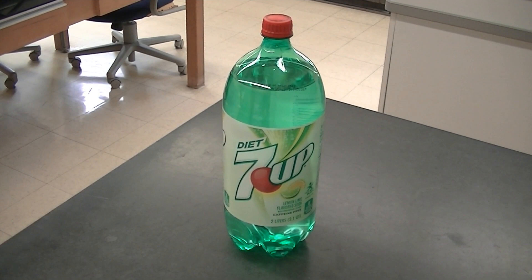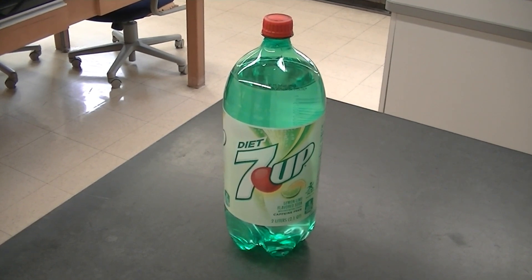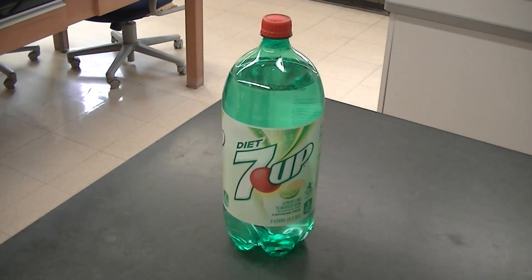Let's see if we can figure out how much acid is in fresh 7up and flat 7up. We'll do this by adding sodium hydroxide base to neutralize the acid in both fresh and flat 7up.